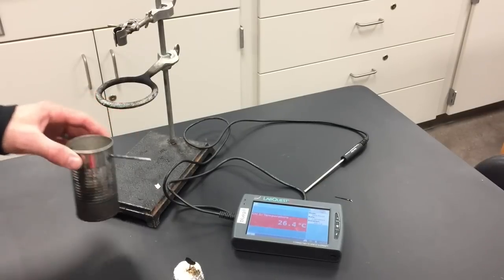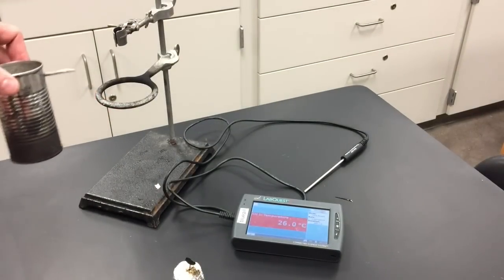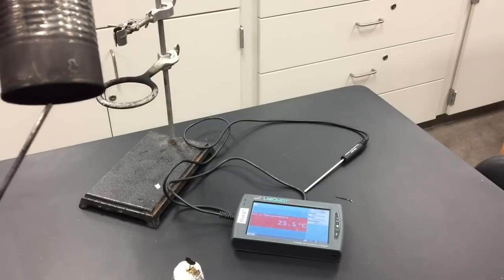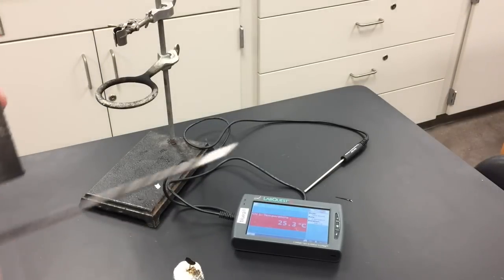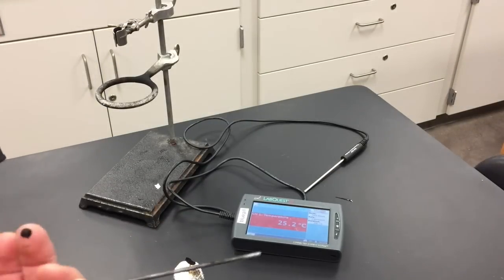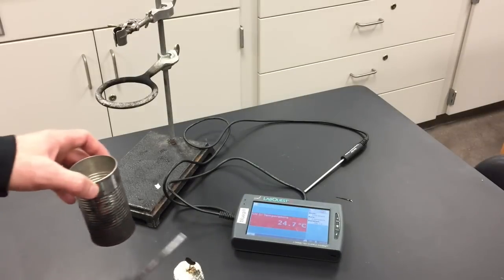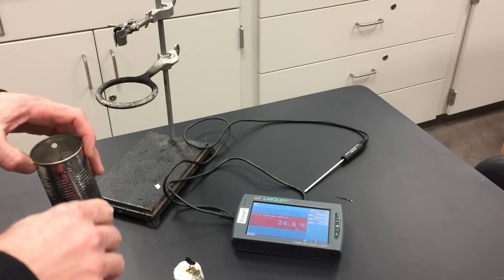When you're all done and you've burned all of your food items, you want to clean up. Take the soapy water and scrub the bottom of the can to get some of that soot off. The bottom doesn't have to be perfectly clean, but get some of the soot off because that soot's going to get on your clothes really easily. Then spray off your table and wipe your table off as well.